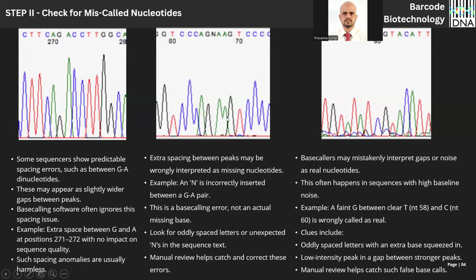But here, see the oddly spaced nucleotide N here. G here is correctly called. Adenine here is correctly called. There is no need for N. Am I right? There are no ambiguous peaks here. So there is no need to call them any nucleotide, that is N, which should be removed. So if I am you, I will open the chromatogram, select the nucleotide and remove.